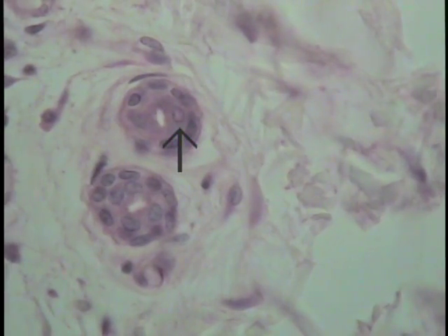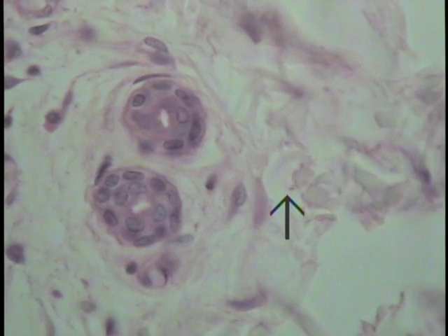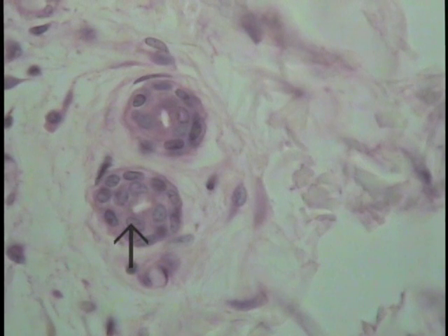This is an example of those two profiles seen at lower magnification. This little circular object is the duct through a sweat gland. The lumen, shown at the tip of the pointer, is that light or clear staining area. Note that once again you have two layers of cells.